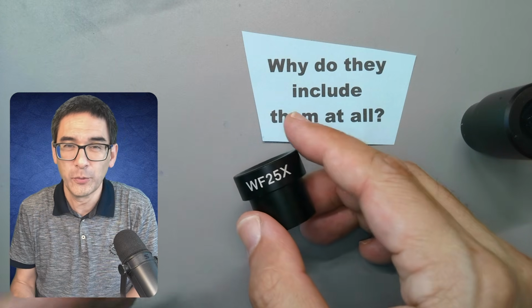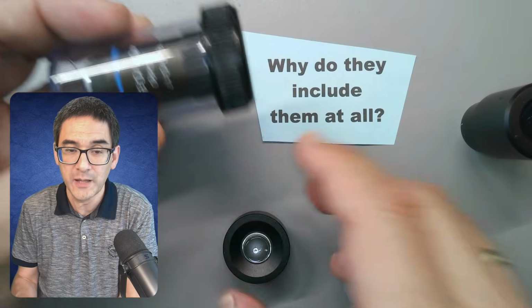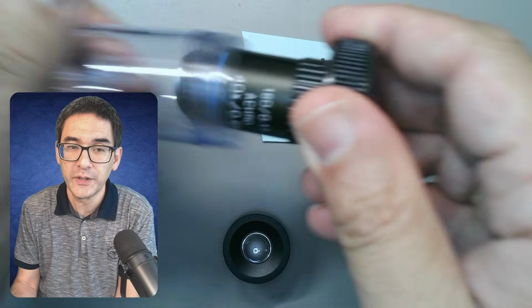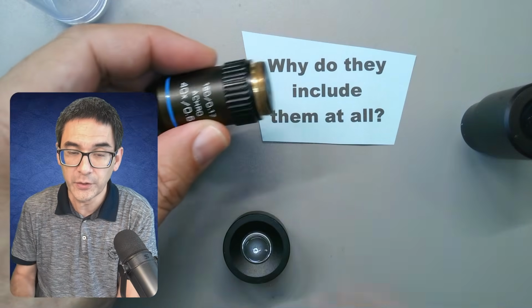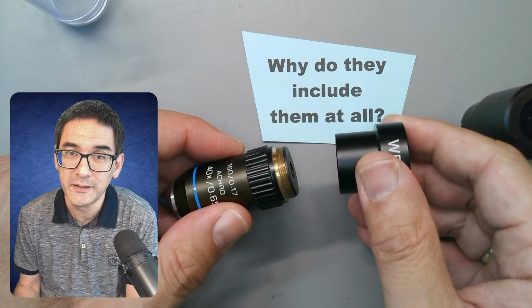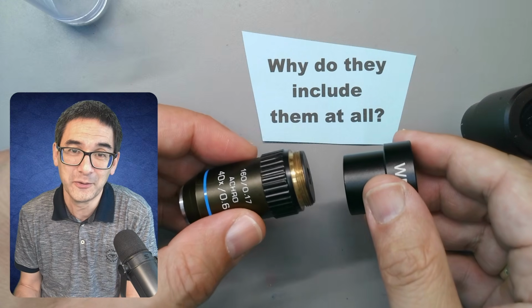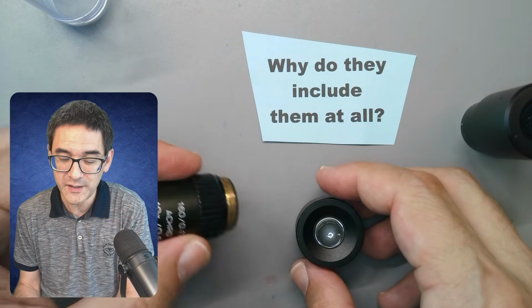So the microscope companies are not really lying when they say it's able to magnify up to 1,000 times. For example, we've got a 40 times objective and a 25 times eyepiece. All of a sudden, we've got 1,000 times. Mathematically, that's correct. But you're not going to see a lot. So that is, I think, one of the reasons.